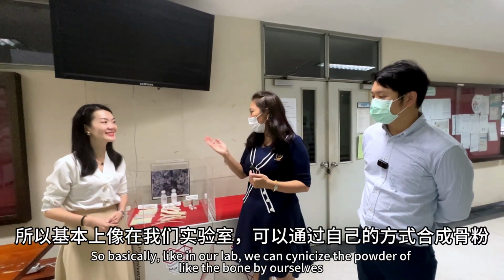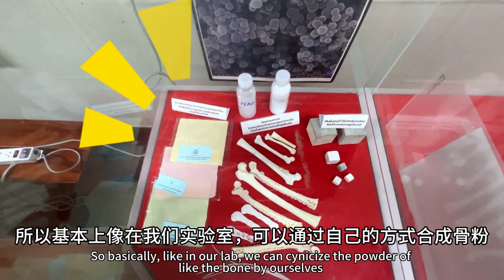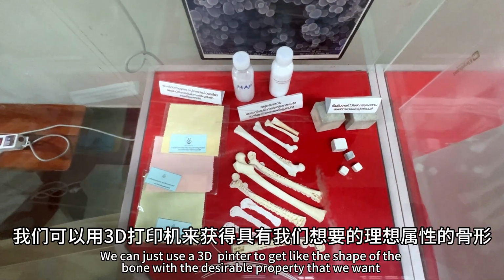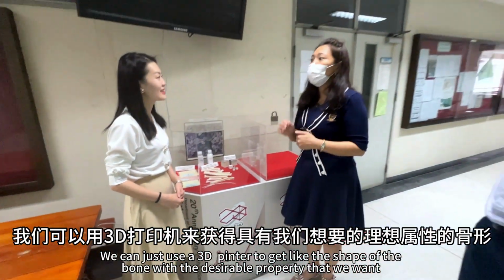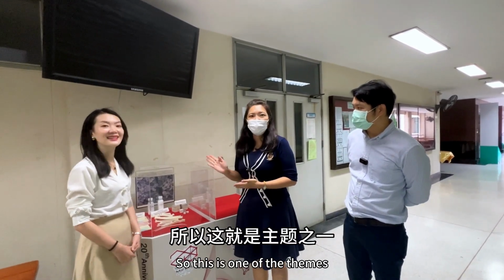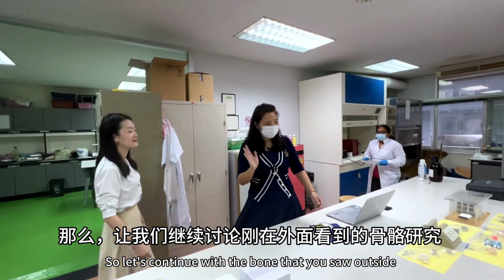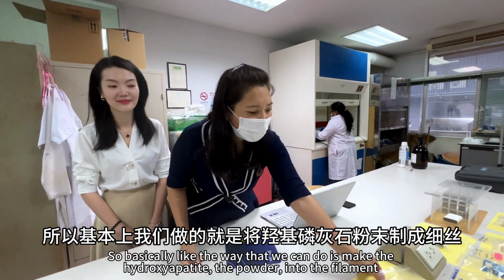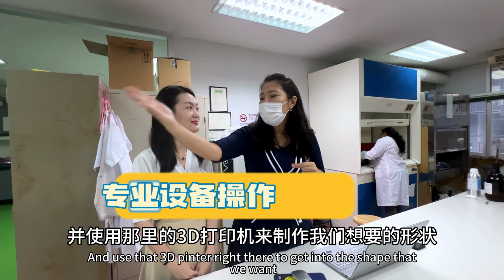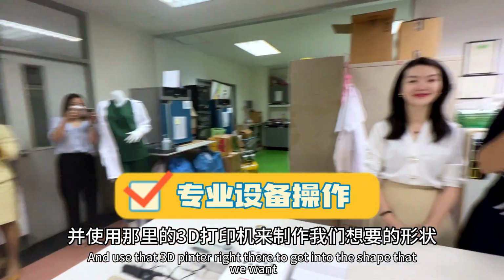In our lab, we can synthesize the powder of the bone by ourselves. Then we can use a 3D printer to get the shape of the bone with the desirable property that we want. So this is one of the themes. Let's continue with the bone that you saw outside. We make the hydroxyapatite powder into a filament and use that 3D printer right there to get the shape that we want.